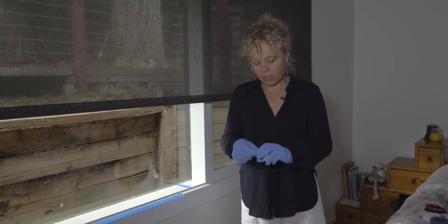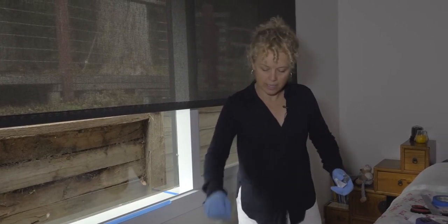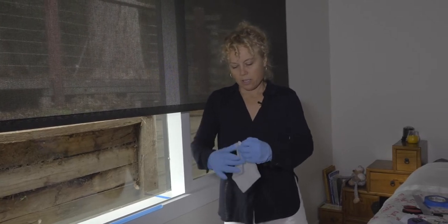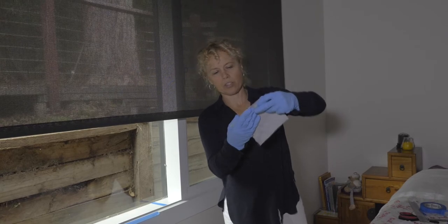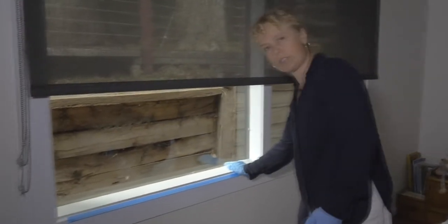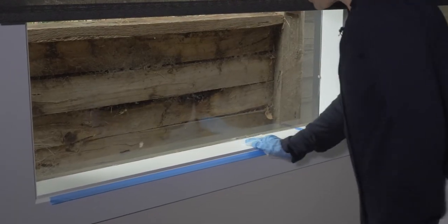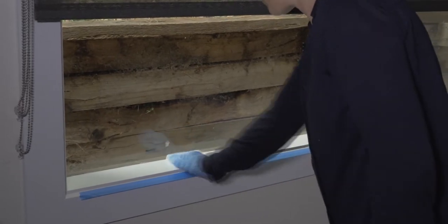Then you're taking the ghost wipe out, and normally I grab a corner and shake it out like that. Open it right up. So opening it up like that, then with your thumb and your fingers, you're going to press quite firmly onto the surface, and normally in an S-wipe motion, try and gather all the dust on that surface. I'm pressing quite firmly.